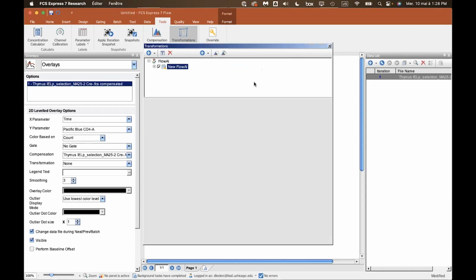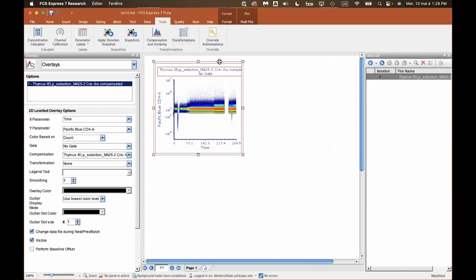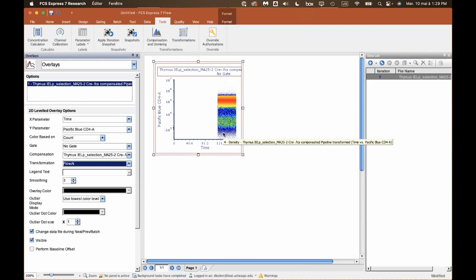At this point, this is all we need to do for this particular transformation. We're just applying Flow AI. So I'm going to close my transformation window. And if I want to apply it now to my data file, I'm going to the overlay in FCS Express and go to transformation and just apply that new Flow AI pipeline that I just created. And after a short while, the software calculates the outcome. And now we've removed all this weird data that differed during the acquisition. And we have something that's a bit more reliable.